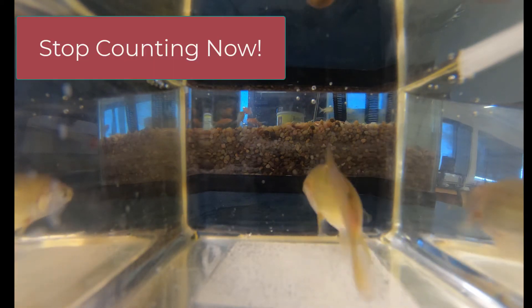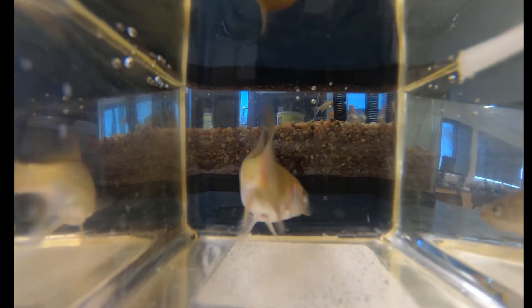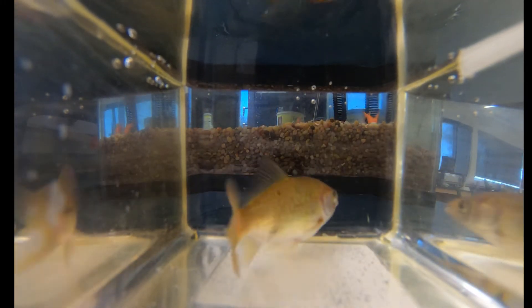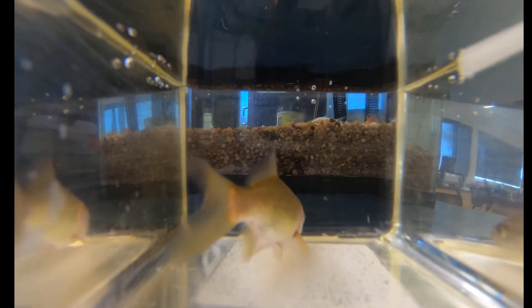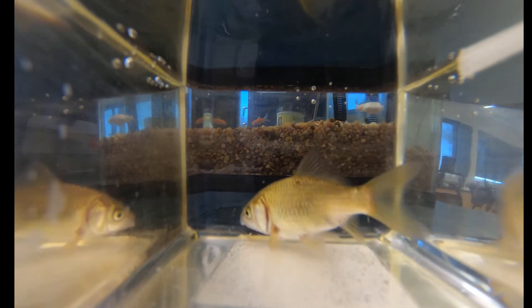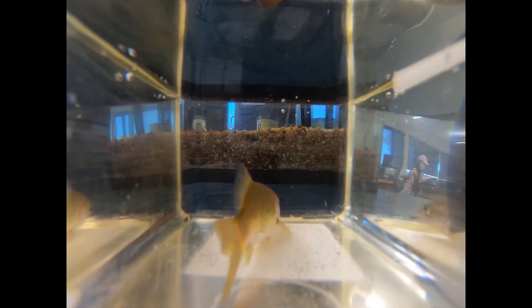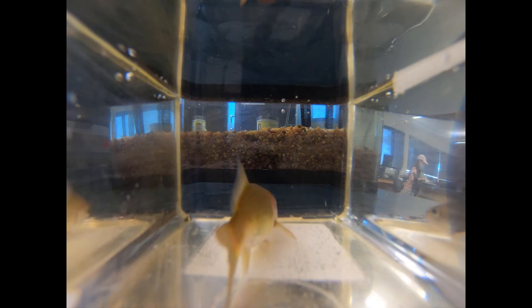Start counting now — and stop. Trial number three only lasted 10 seconds, so we need to multiply that number by six to get operculum movements per minute, so that they're all in the same ratio. This is a common problem in animal behavior studies when we try to record behavior using video, because if the animal moves or changes angles it can be very difficult to see.